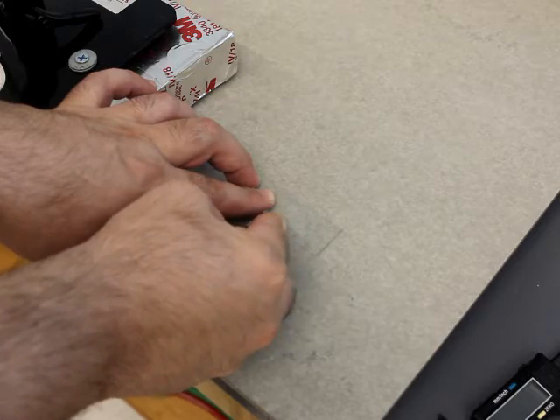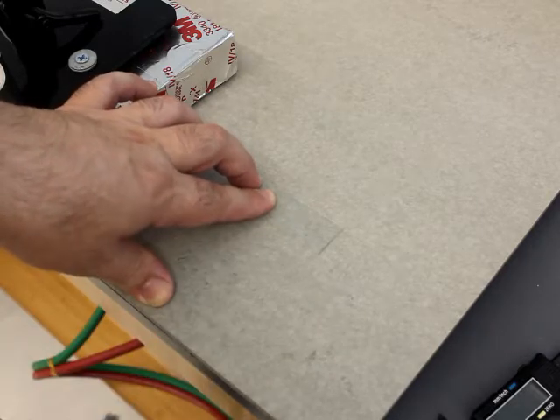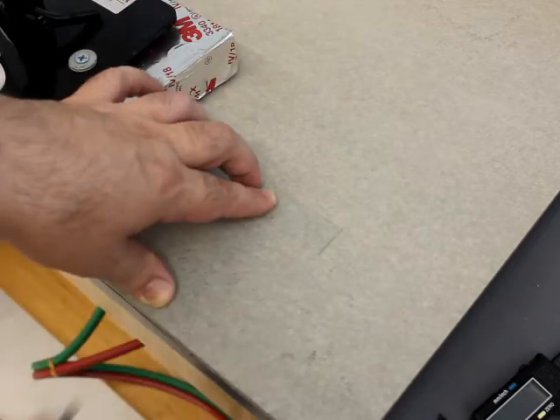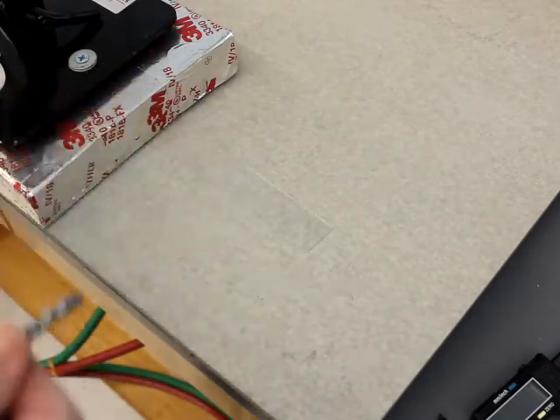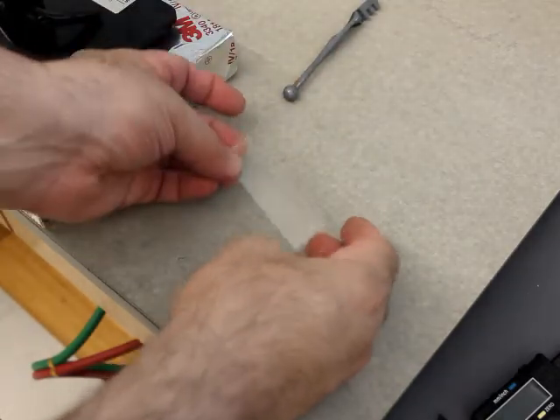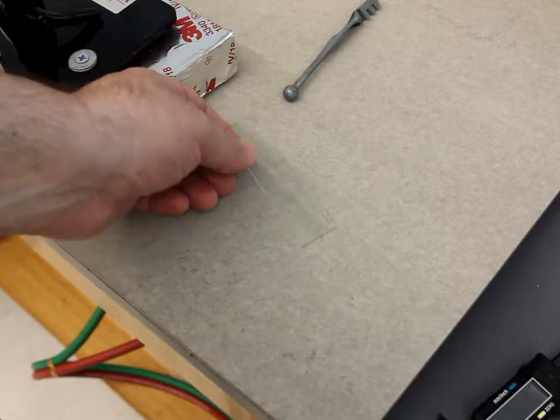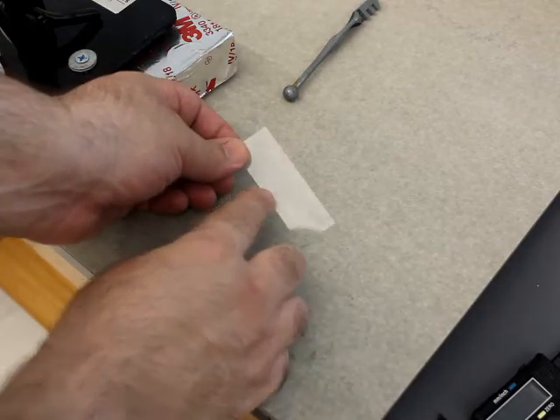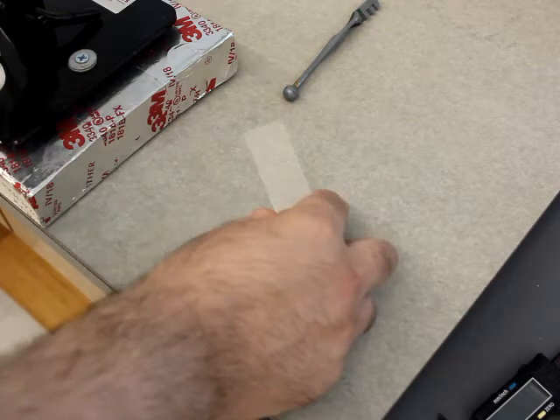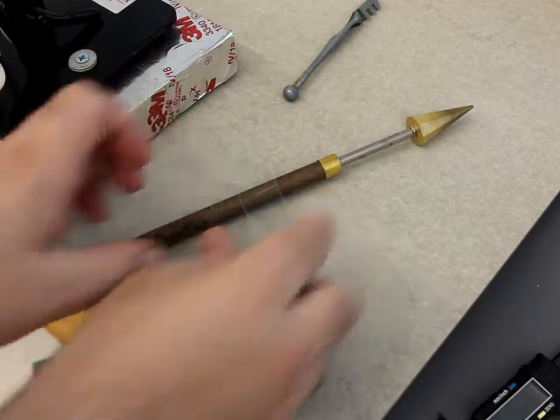I'm actually slowing down and removing pressure as I approach the edge, and the reason why is I don't want to hit this little edge very rapidly because I could end up chipping the glass at that point. So now, before I actually attempt to break this, I do want you to see the scratch.